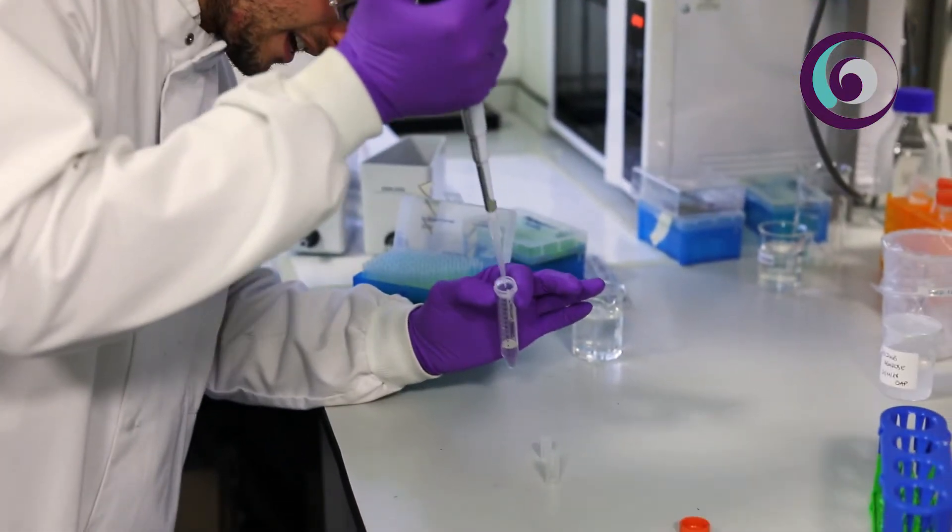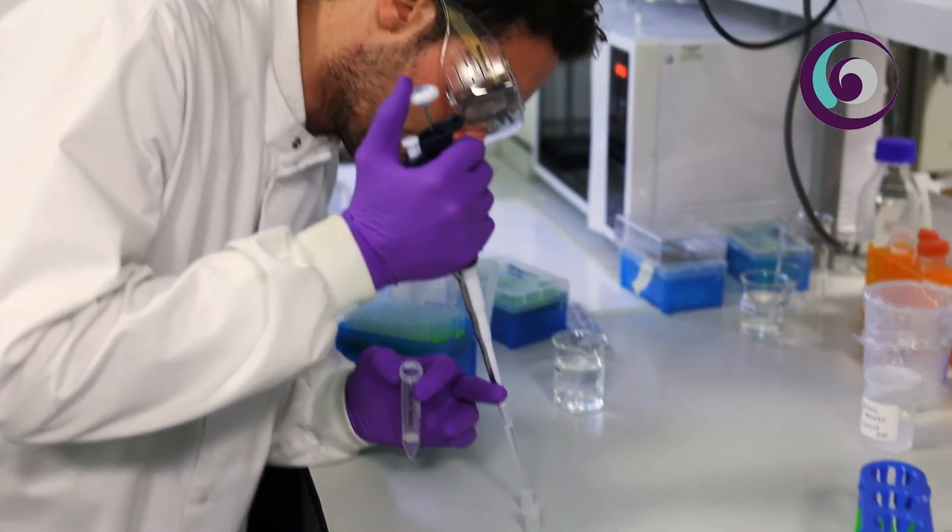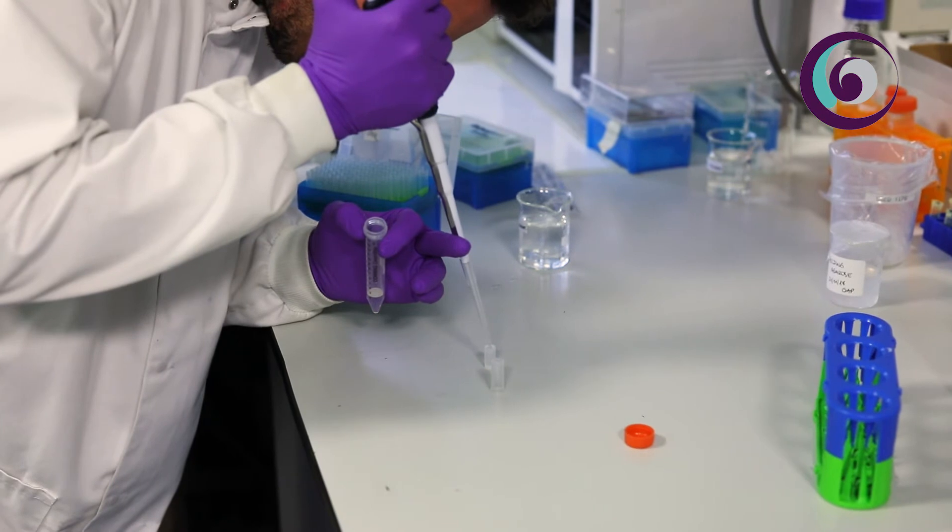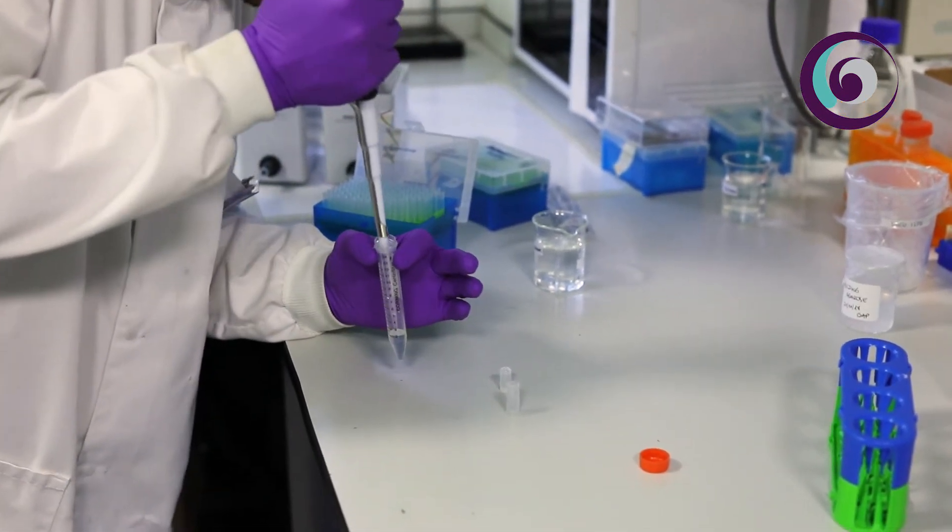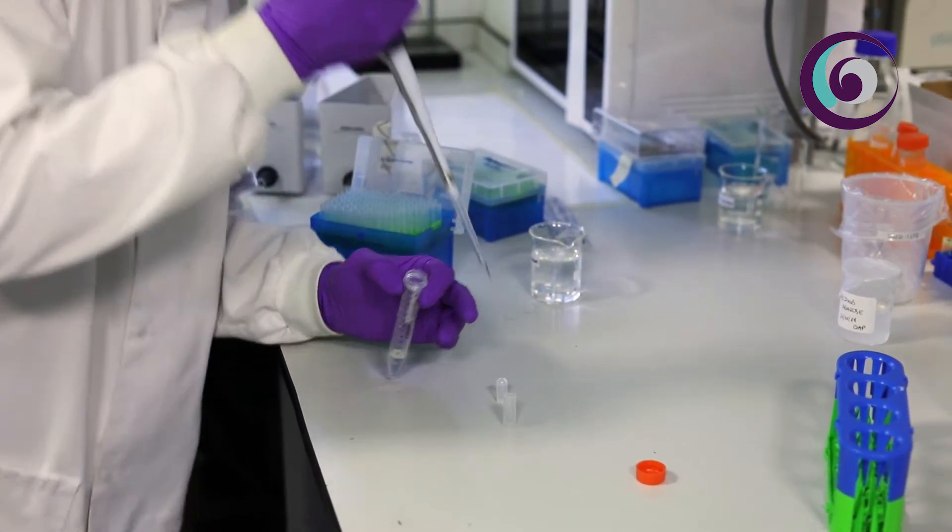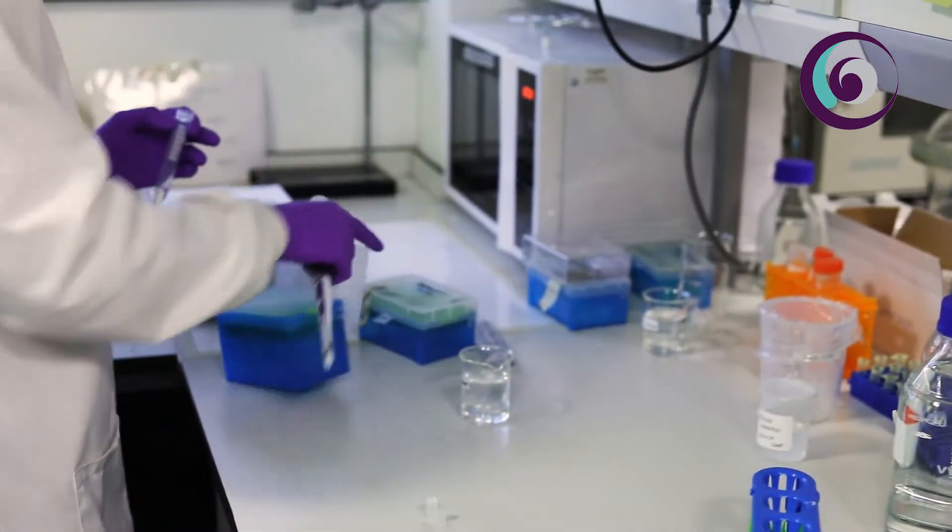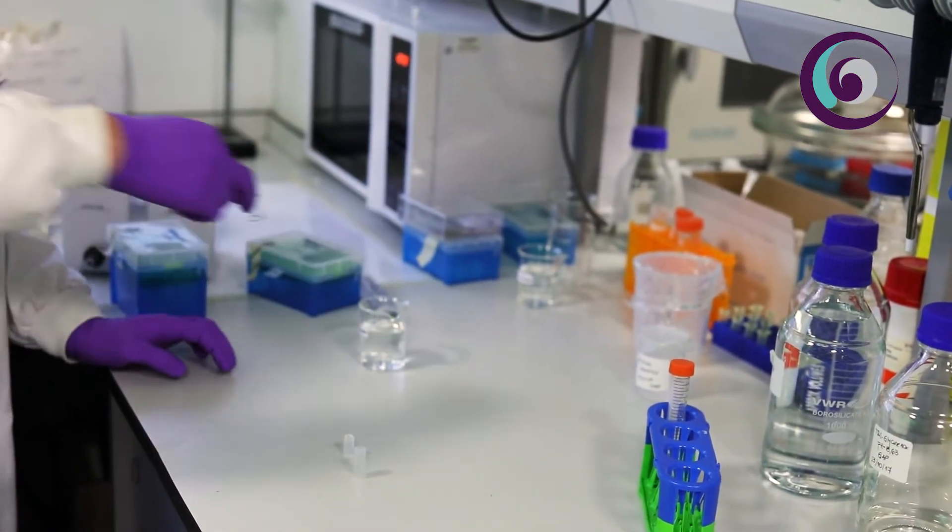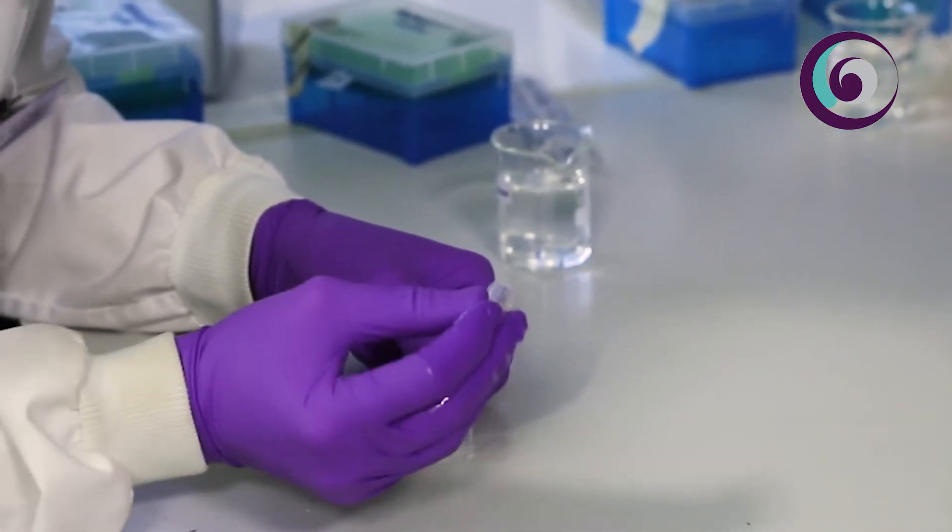In this case I'm using polyacrylamide 3% so for this we just set the gel and then pour the gel in the capsule avoiding the formation of bubbles. Another key point here is once we pour the gel into the capsule we leave a little meniscus on top of the capsule which will allow us to stick the membrane on top of that meniscus. Then with a top part that is a cut eppendorf we will clamp the membrane into the bottom part.